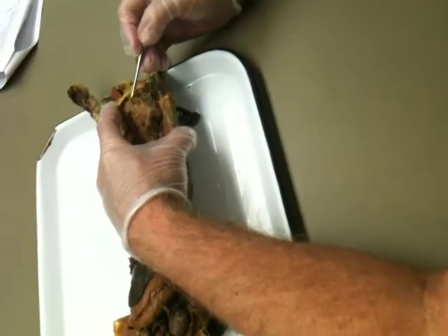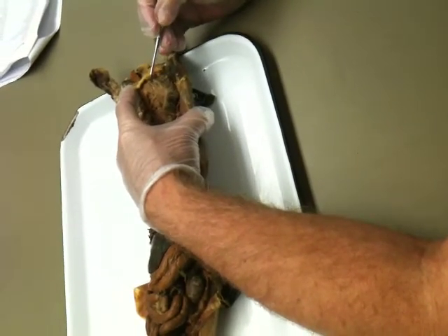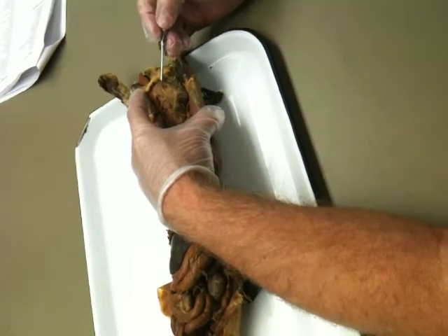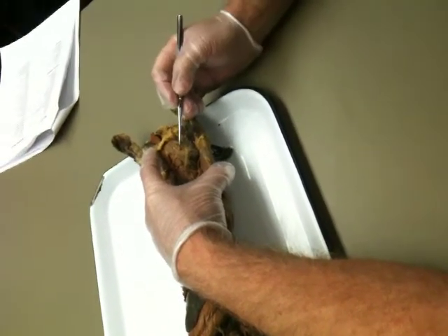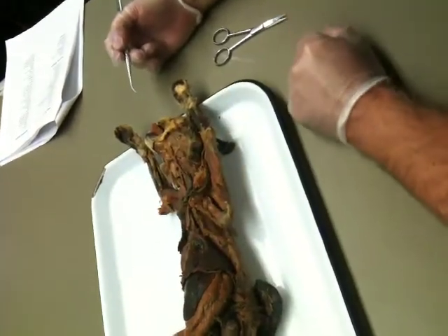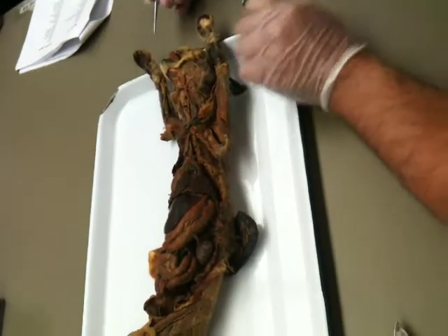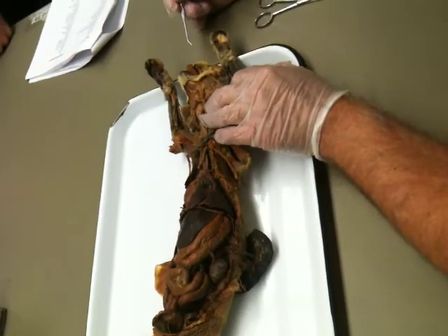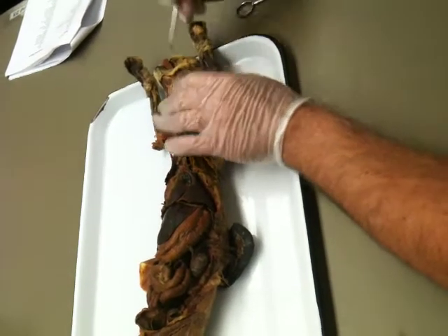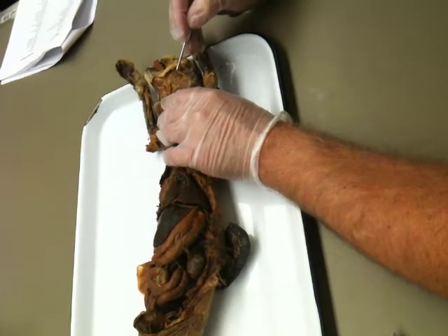So I really don't think this cat's all that exceptional. It's right there, and it runs right across the masseter. This is the masseter. This is the duct, the parotid duct coming from the parotid gland. Cross off Wharton's duct. Wharton's duct drains the submandibular, and we can find it on some cats, but most people will never get to see it. I'll call you over if there's a cat that's got a good one if you're interested.